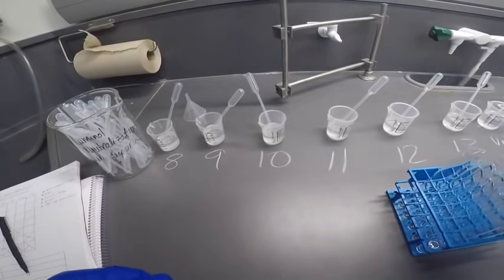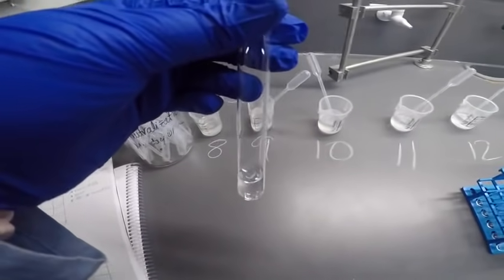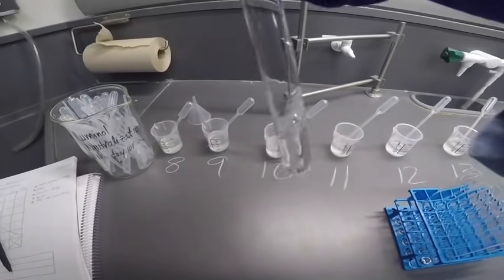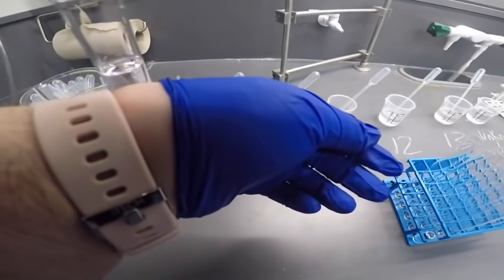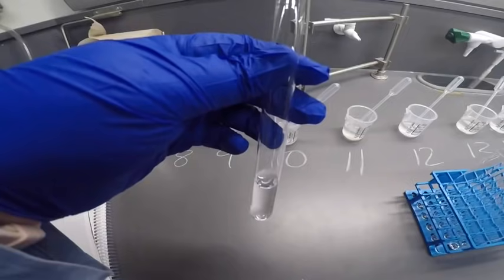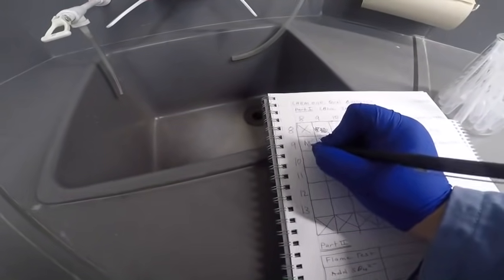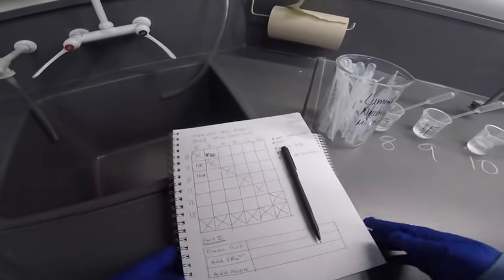All right, let's do 8 plus 10. Put 8 in first, then 10. All right. We don't see a precipitate. Oh, it did get warmer. So we have some heat there. No bubbling. No smell. But we did observe it getting warm. So my matrix here, oh, I went the wrong way. Okay, and then heat. I'm supposed to go down for the blue. It's hard because this is just my lab notebook I write in, so I don't have any color coding.